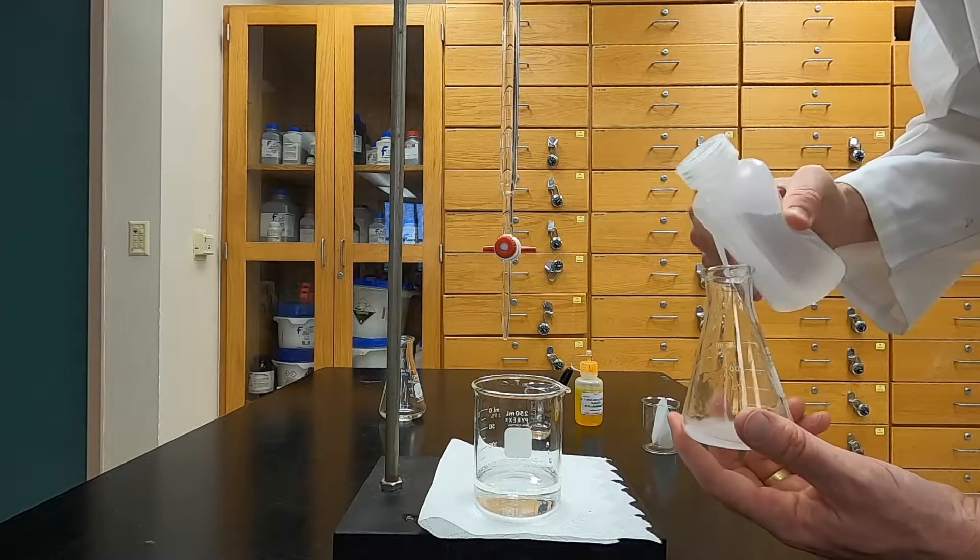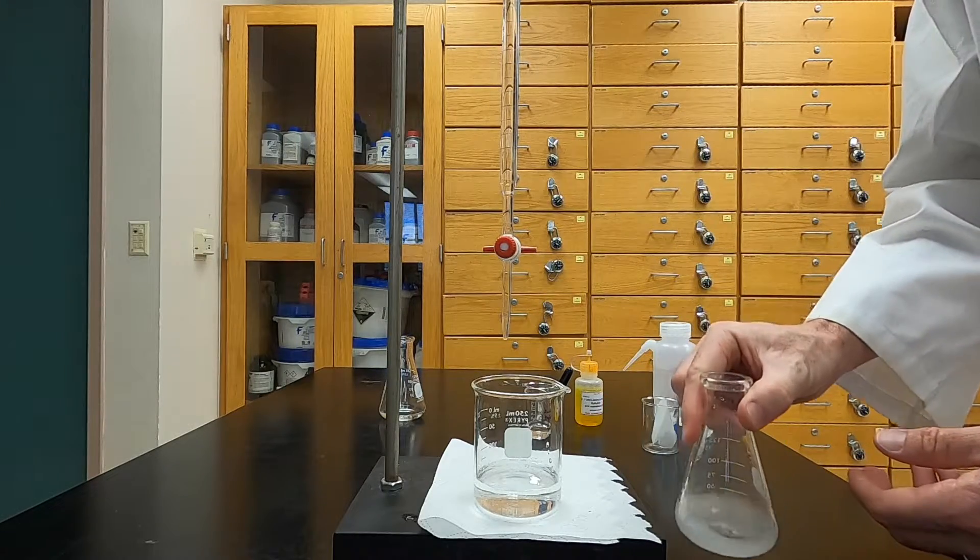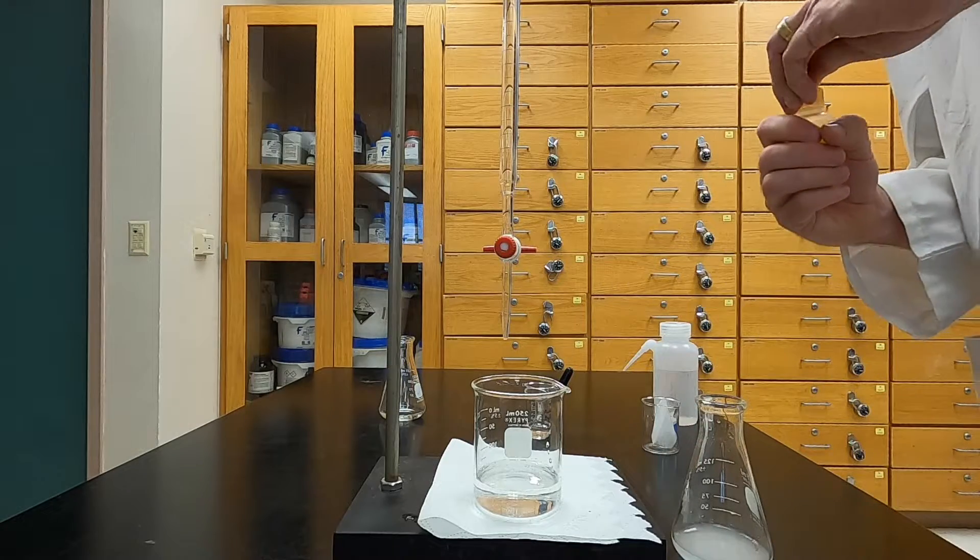Once these components have been added, swirl the flask and add some additional DI water to ensure that everything is properly mixed and in solution.